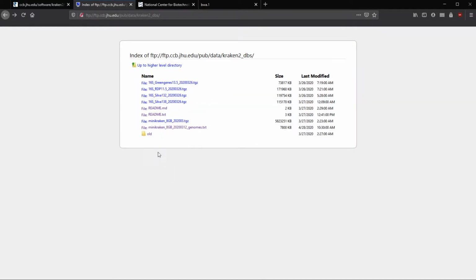And if we wanted to download here, I want to download this latest one. So in my window, we right click, we can copy the link location, or alternatively you can just click it and it will download, and then you can move it to whatever folder you want. But if we go to our Ubuntu window now, in here we can type wget and then paste in that link. So here we're pasting in that database link.